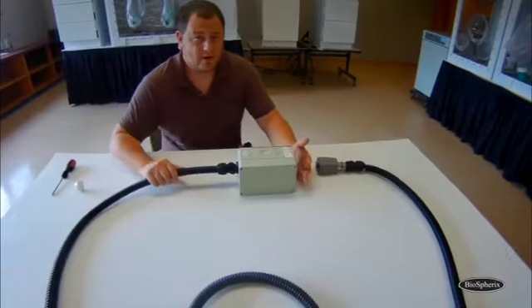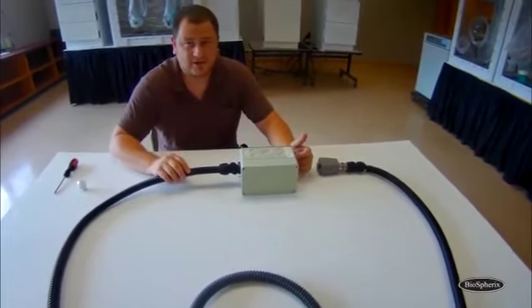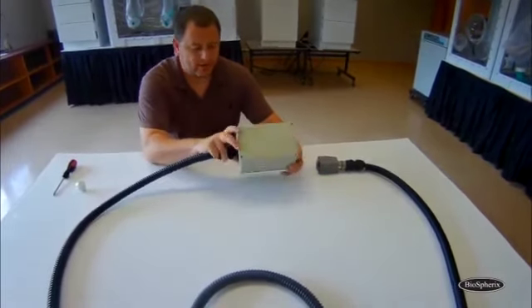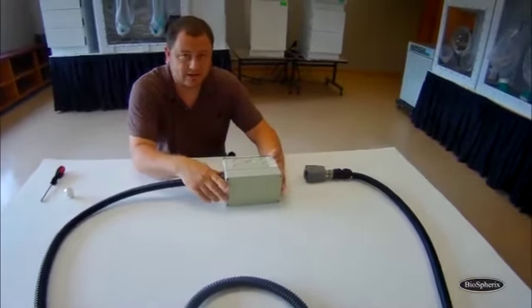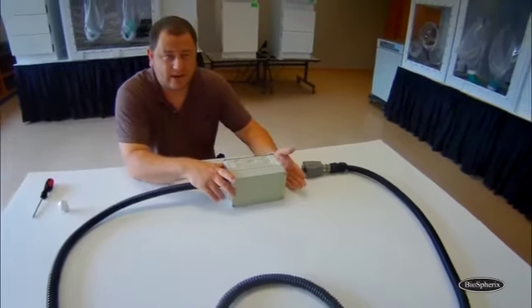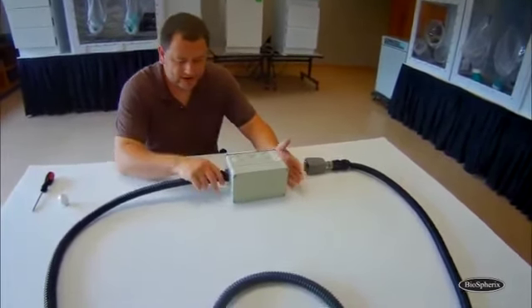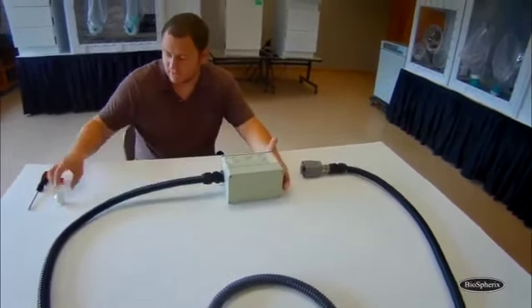I want to do a quick video to show visually how to change the oxygen sensor for your animal actuator pods. So these pods are going to be with your OxyCycler system. Usually it's like a model A84. It's going to be your animal setups. It's the pods that take sensor model E445.